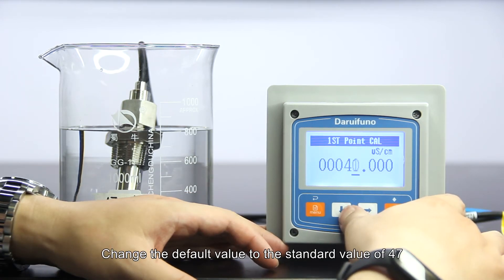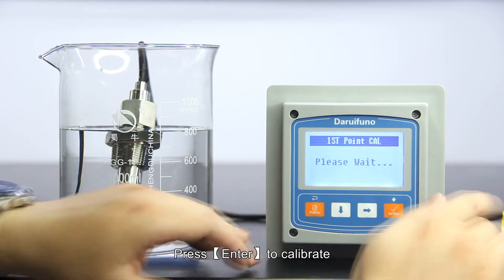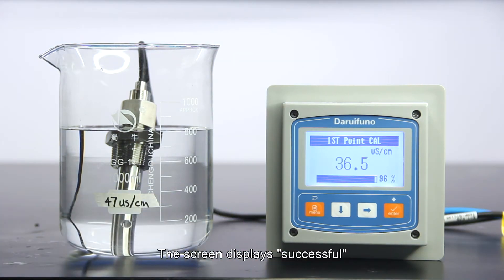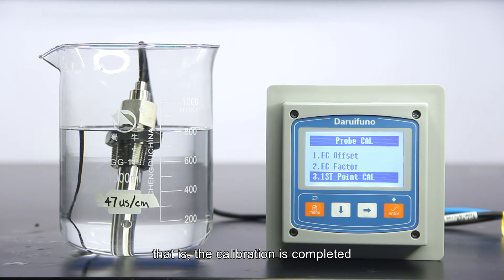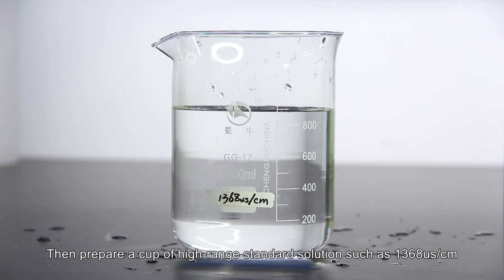Change the default value to the standard value of 47. Press enter to calibrate. The screen displays successful. That is, the calibration is completed.